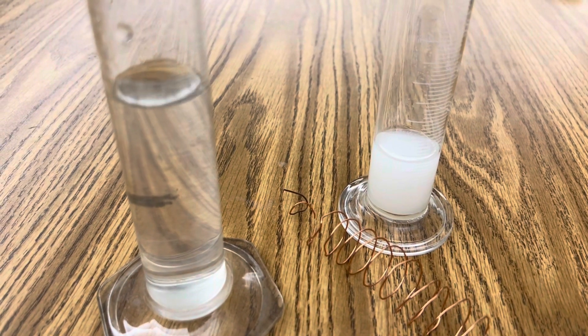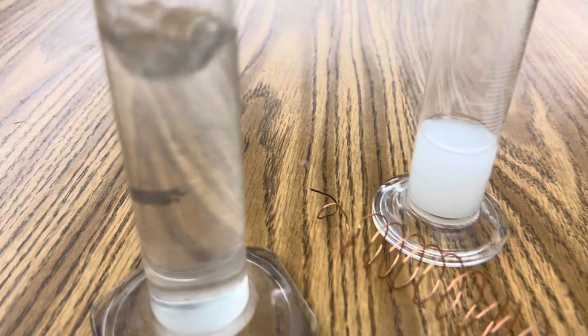If necessary, filter your silver nitrate until your solution is as clear as possible.